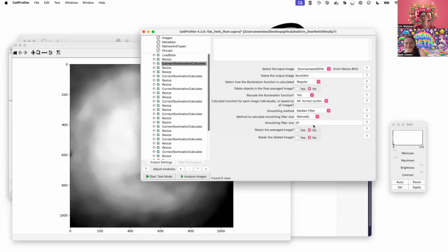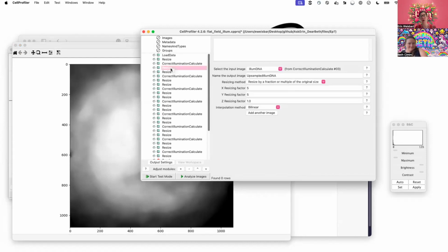But getting in and changing these sizes is how one would handle that. And in this pipeline, we then resize it back up. We scaled it down, so then we scale it back up to be the correct image size. One trick here that I have bumped into, because with this pipeline we do a resizing.